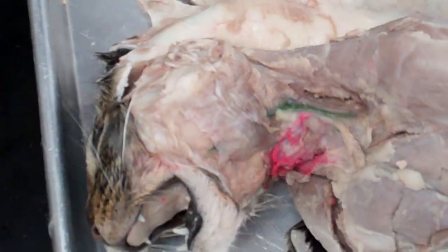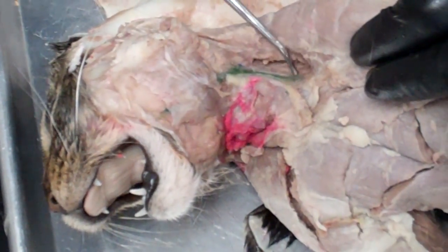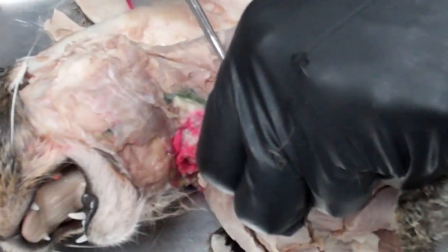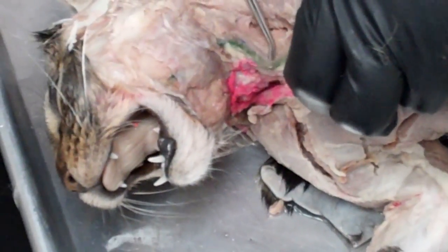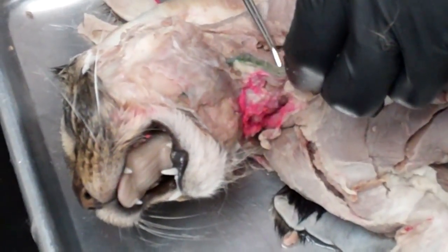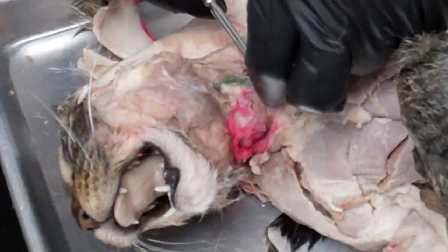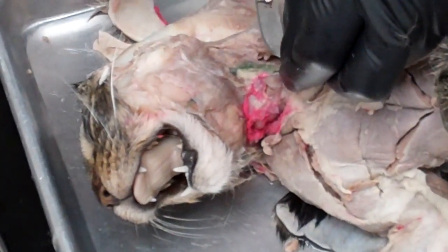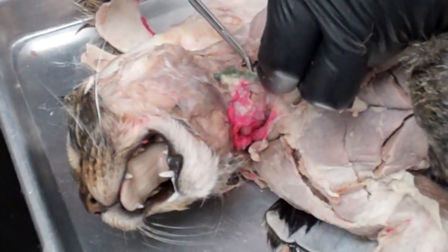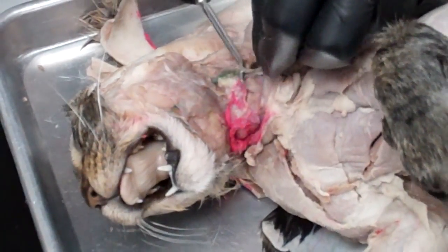The next thing you're going to find is the jugular vein — I've marked it with a green line here. In many of our cats the jugular vein did not get injected, which will make its separation a little more challenging. You need to find this blood vessel running up the neck of the cat and separate it from the underlying muscles.